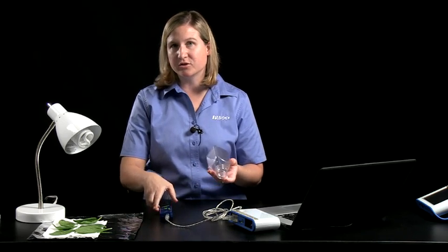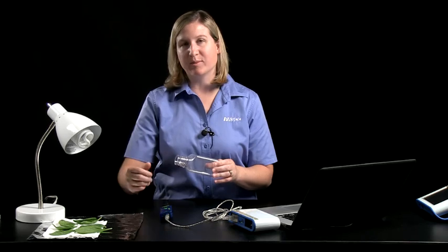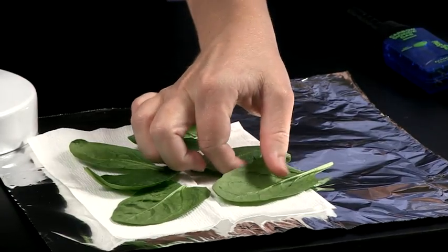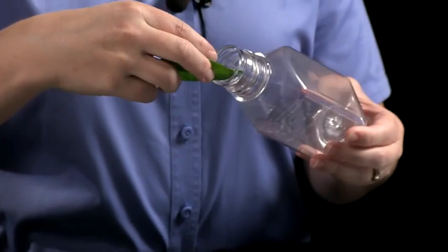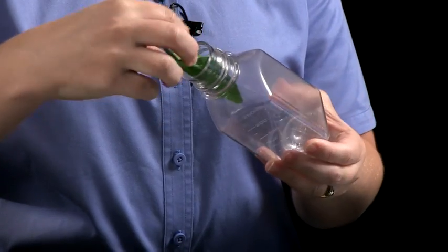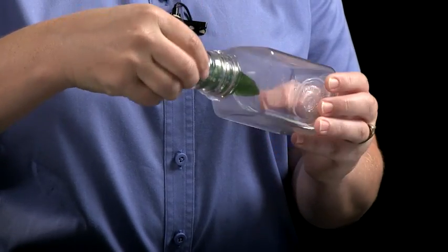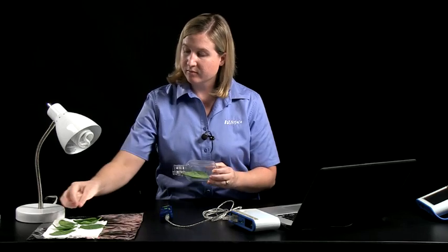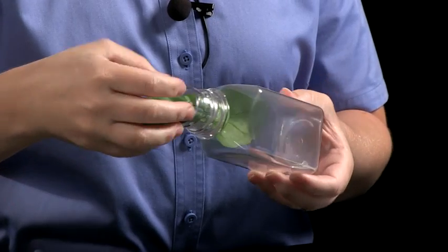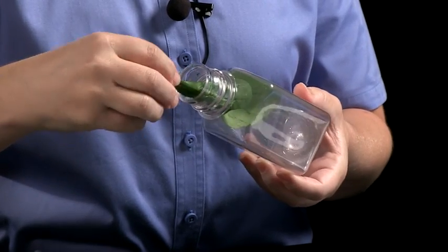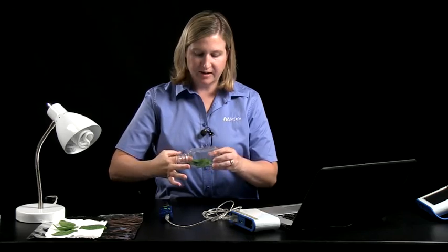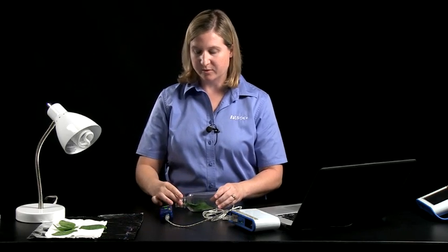I'm going to place one or two spinach leaves into the bottle. It just kind of depends on the size of your spinach leaves. I've gently blotted the leaves so that they're mostly dry, and ideally we would have the spinach leaves lay flat. So I'm going to put spinach leaves through the opening of the bottle, and I'll go ahead and put a second one in, laying them flat to get the maximum amount of surface area that can be exposed to the light.